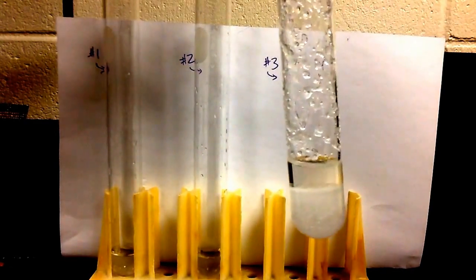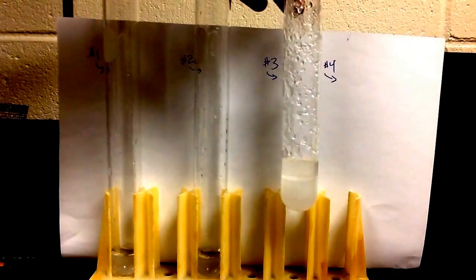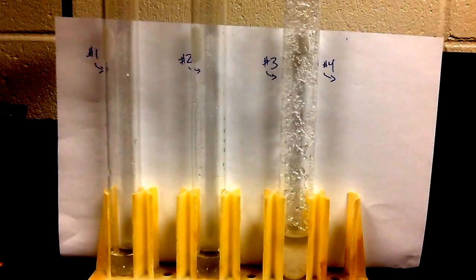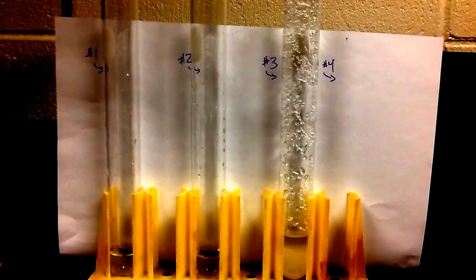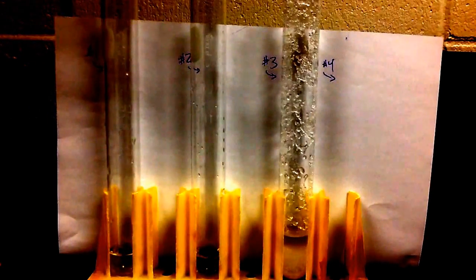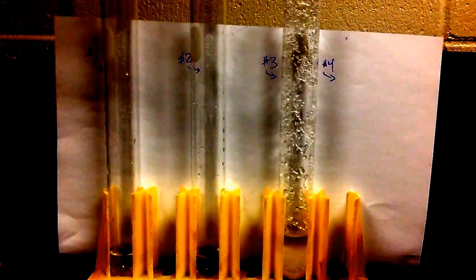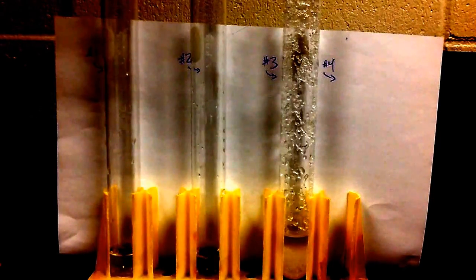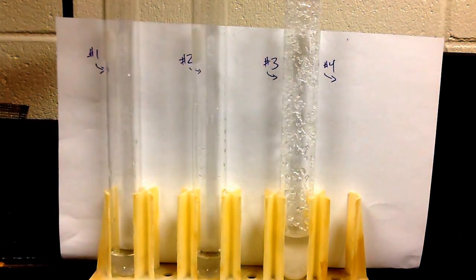So we pour the solution back in, and then we're going to heat it up. We know that increasing the temperature for most solids will increase the amount of chemical that can dissolve. So we've heated it up, and then we cooled it back down very slowly.